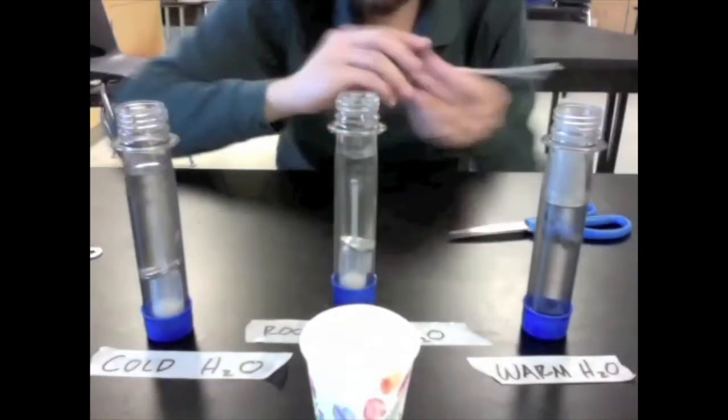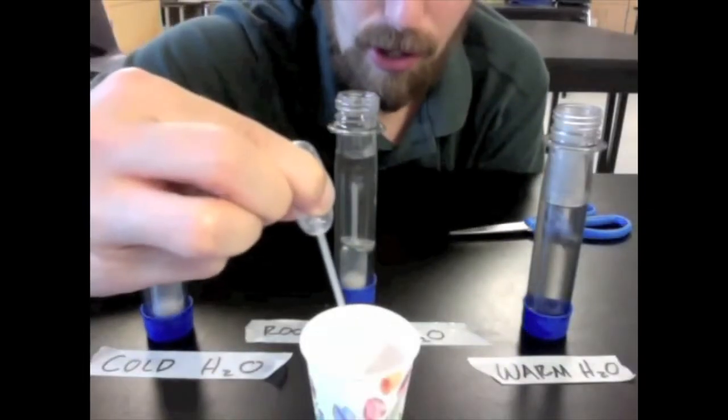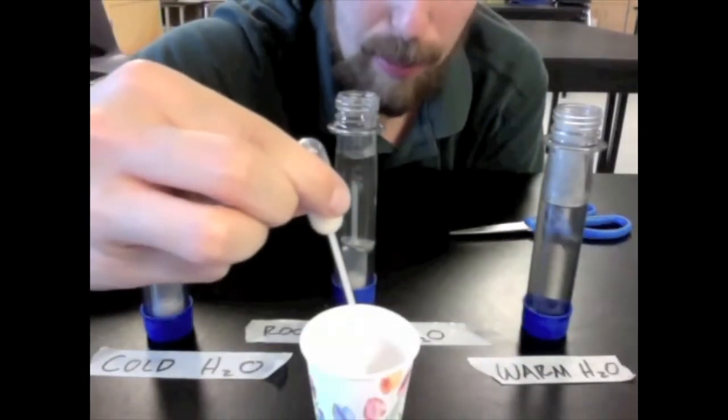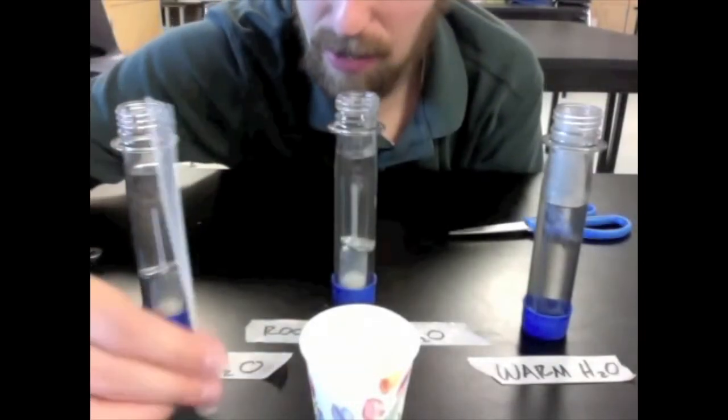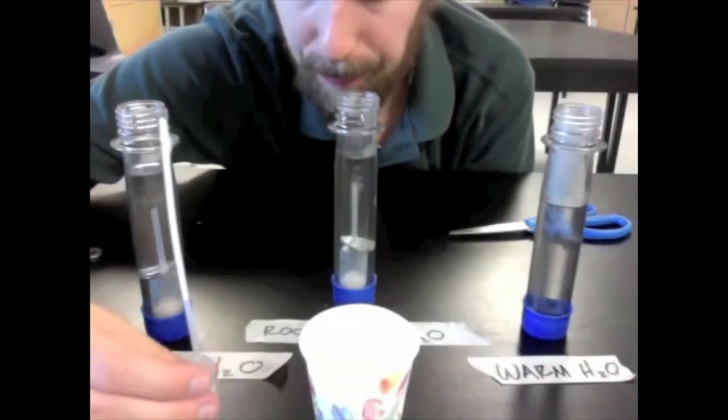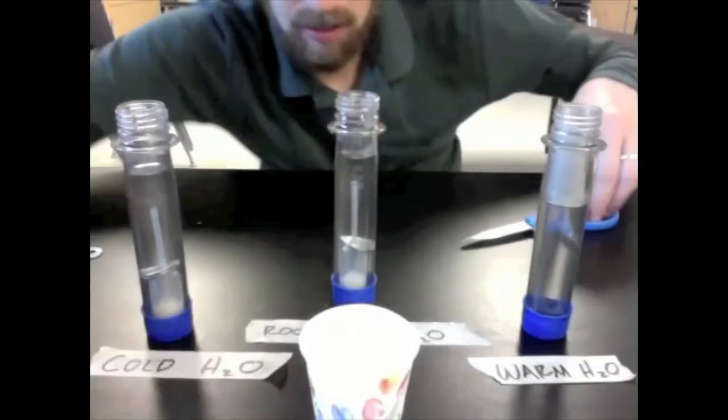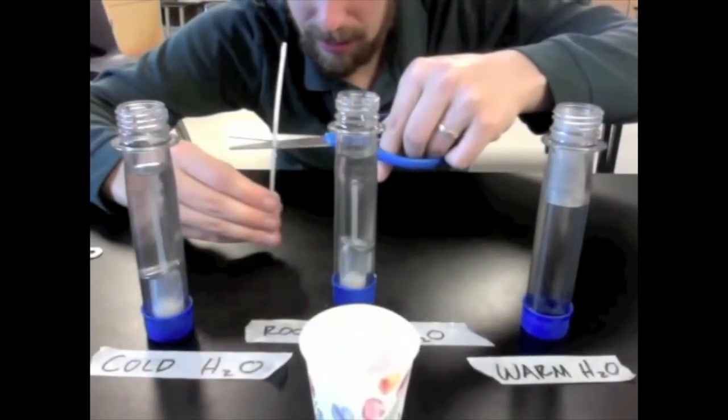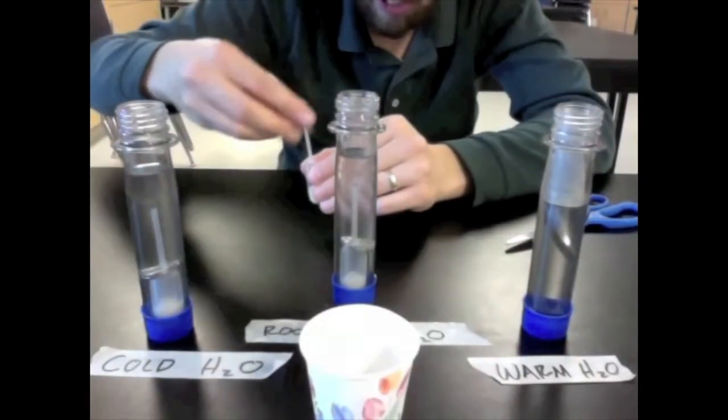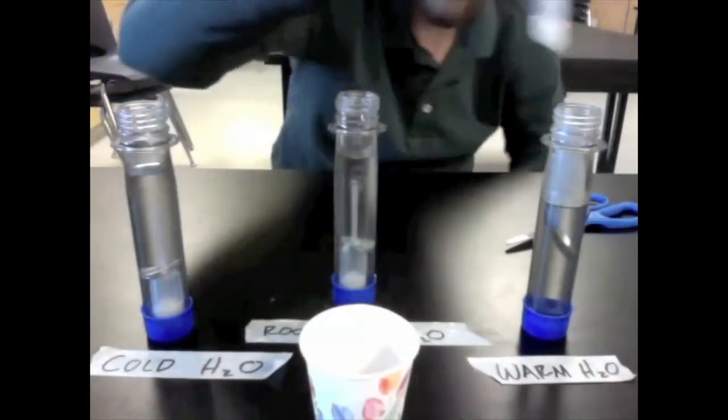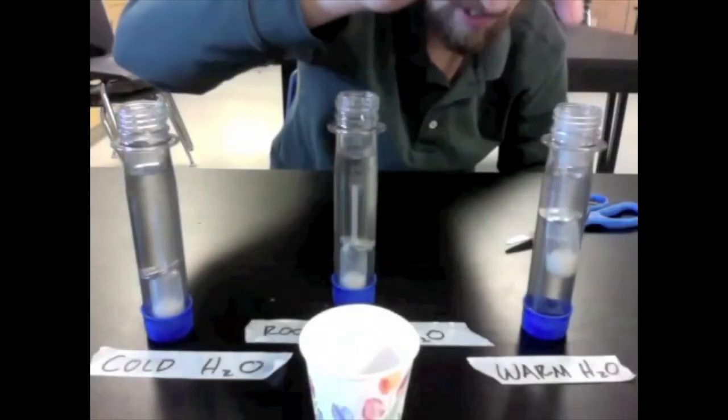And then finally we've got our warm water trial, so we'll fill up our pipette. Let it settle out of the tube. Cut it like so, drop a couple of washers on there, and in we go.